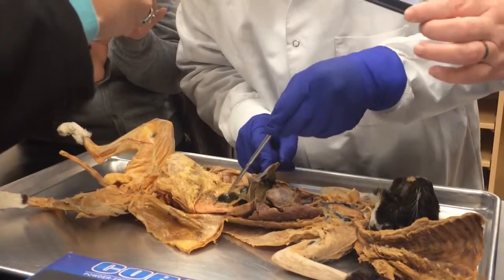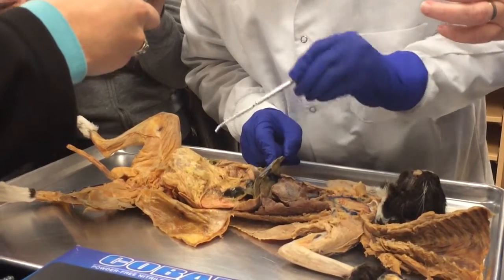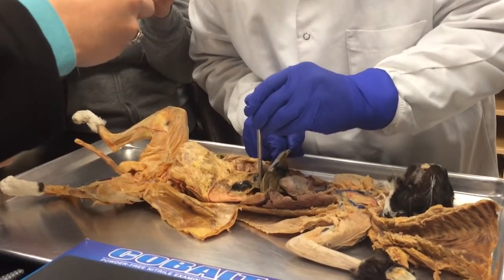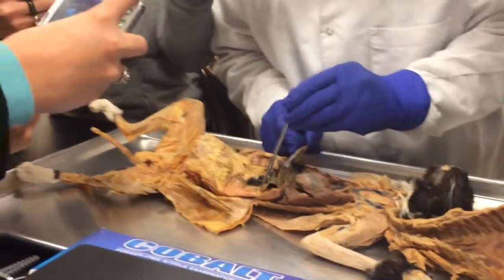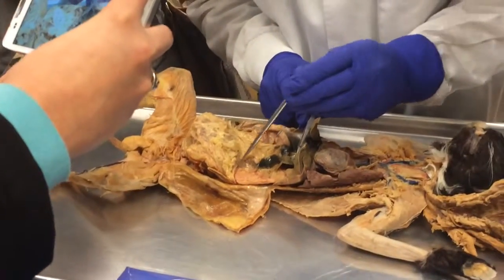The stomach also has a lesser omentum, which is this. You see that? It's on the lesser curvature. And the parts of the stomach, of course, the cardiac part that we said in the lecture is right there by the sphincter, so don't worry too much about that, but really worry about the fundus, which is up on the top here, and most of it here, up to here, is the body.